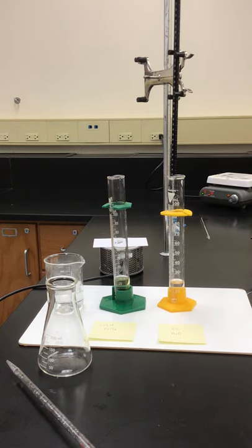If you've made it to this part of the lab, you now know the exact molarity of the potassium permanganate solution that you can see in the background in a burette. Now we're going to be doing a secondary reaction with that potassium permanganate, now that we know its molarity.